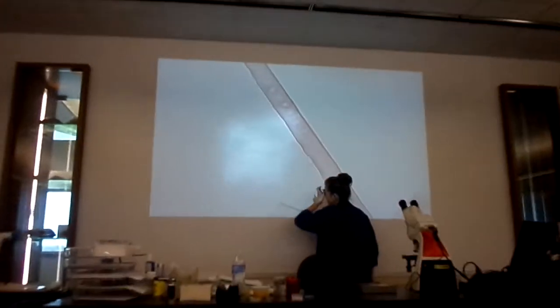This is a tracheid with pits. And the pits are the tiny little holes right there. Those are little pits. So both types of xylem tissue, the ones that are the vessel cells and those that are called the tracheids, both of those cell types help to transport water both vertically and laterally through all the plant parts.